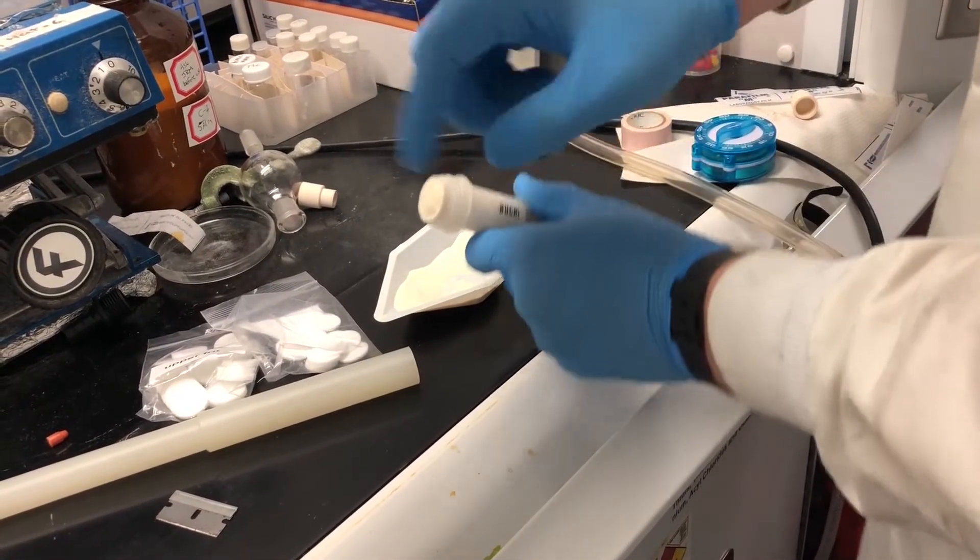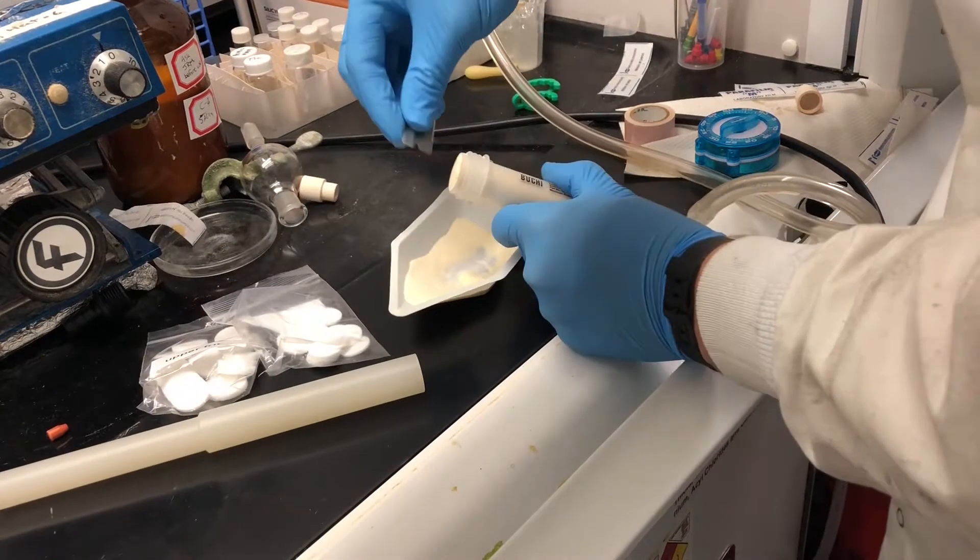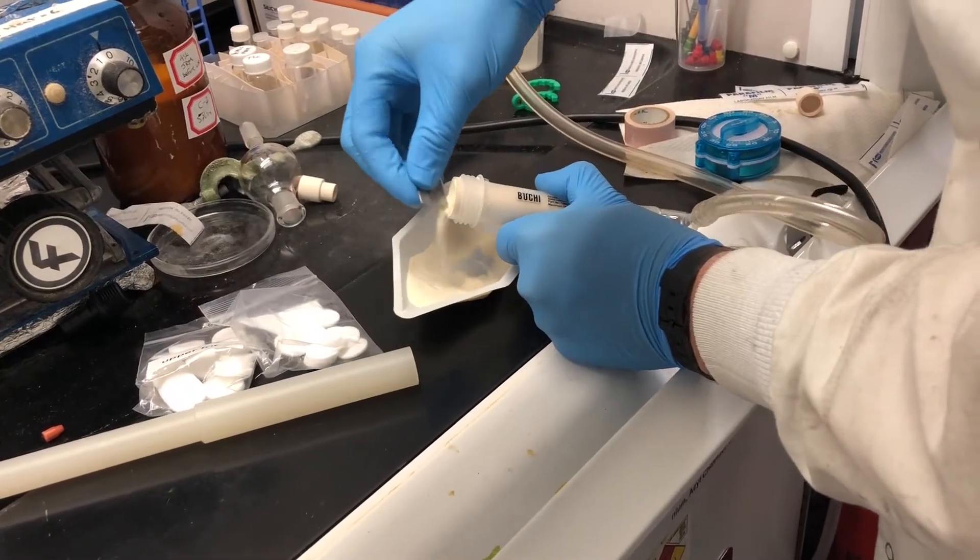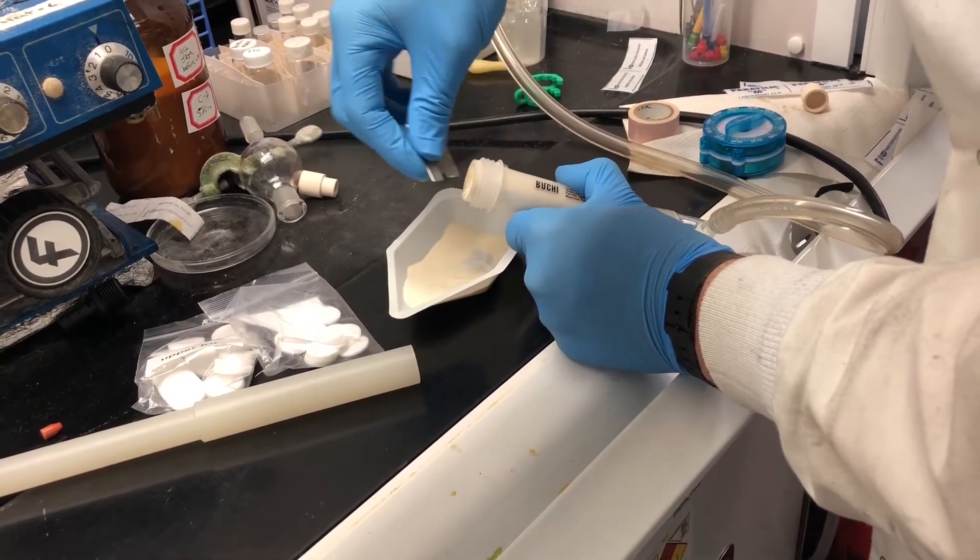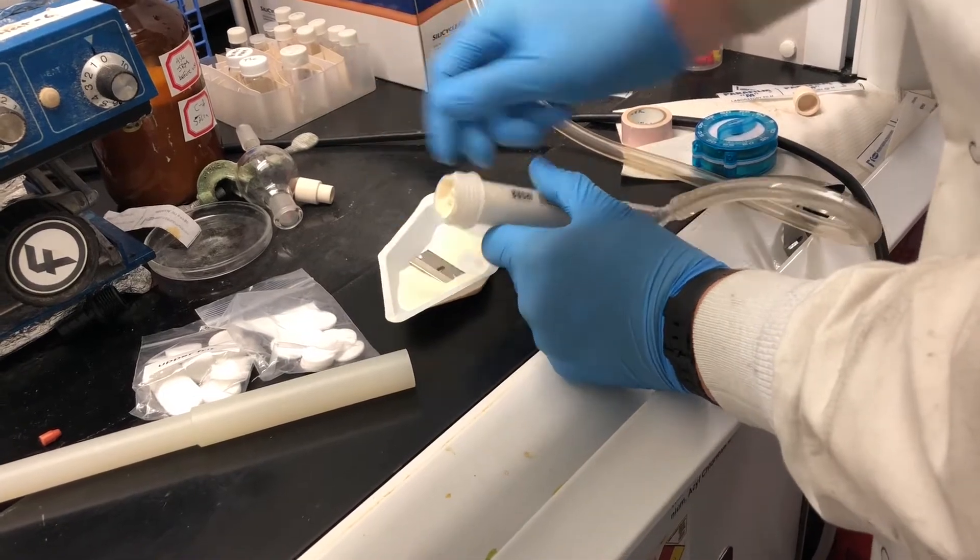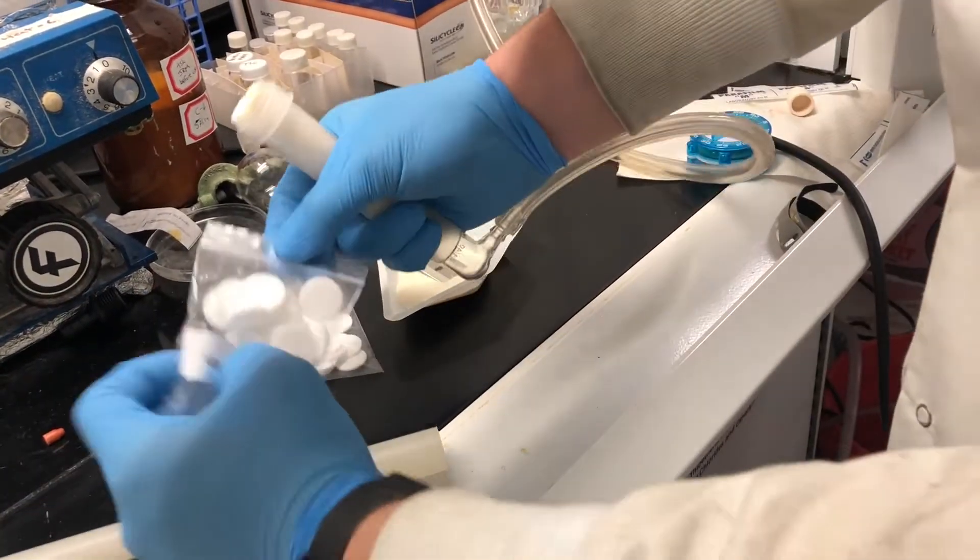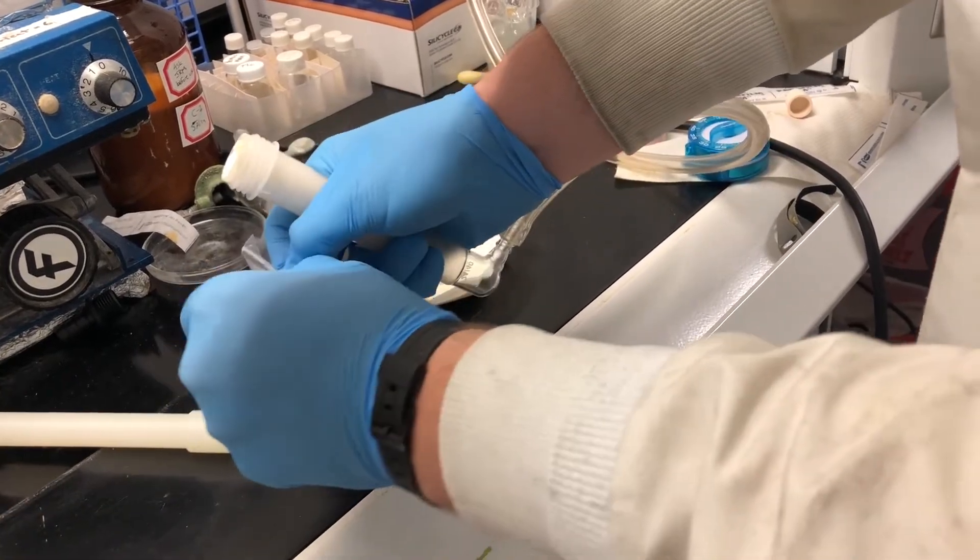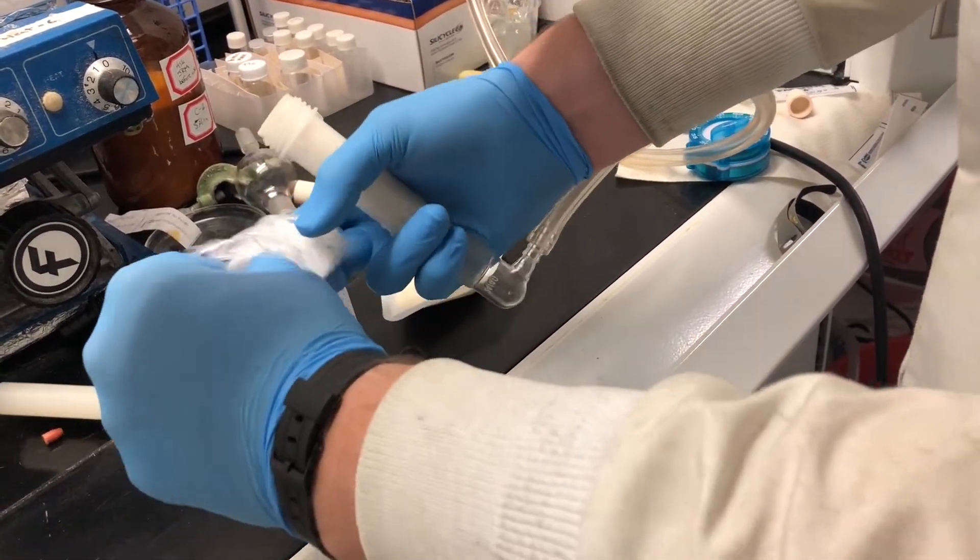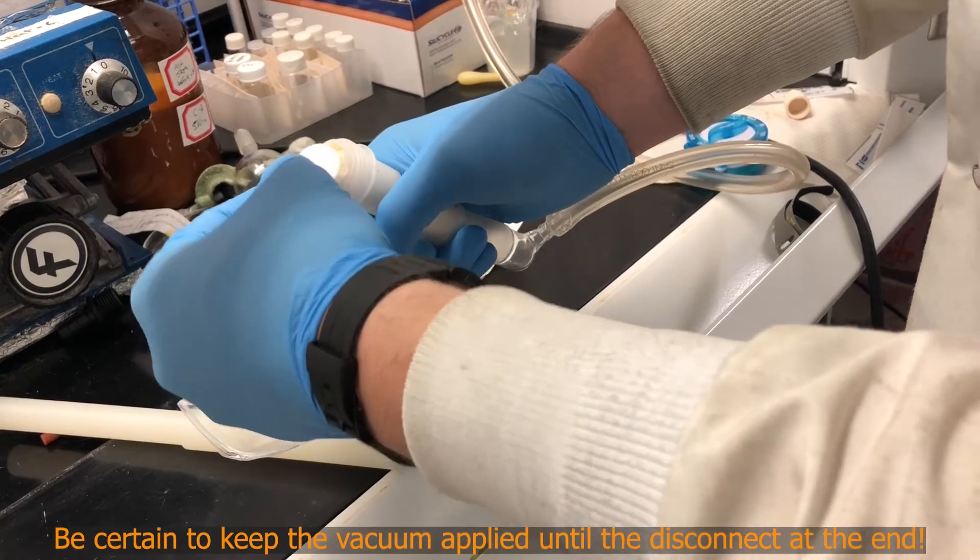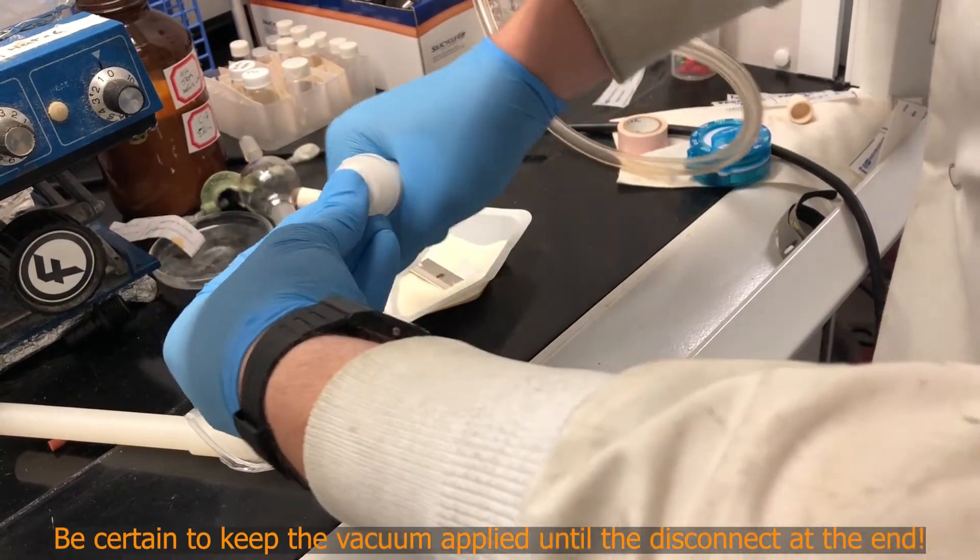That's too much in there. I'm actually just going to take our razor and scrape down a little bit. Now we'll try fitting this and see what happens. We're going to take an upper frit, the ones that are slightly bigger than the lower frit, and place this over the top and push down.